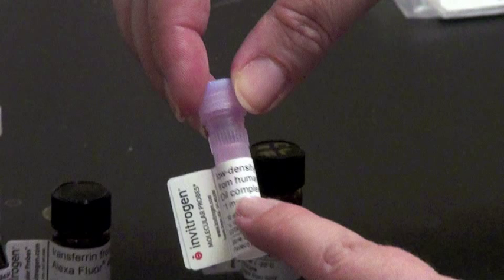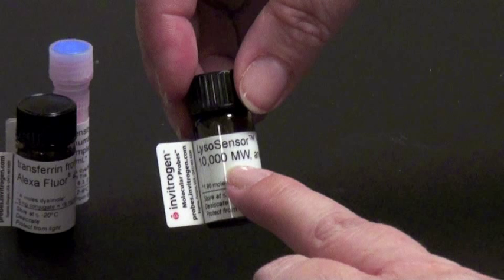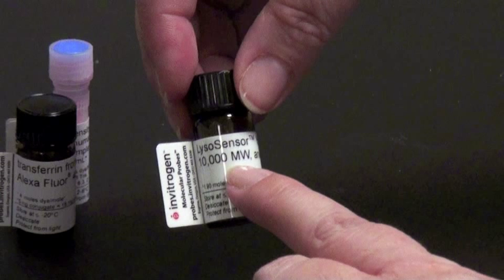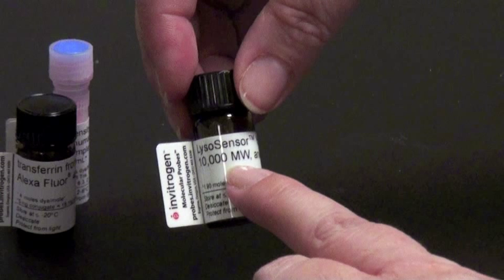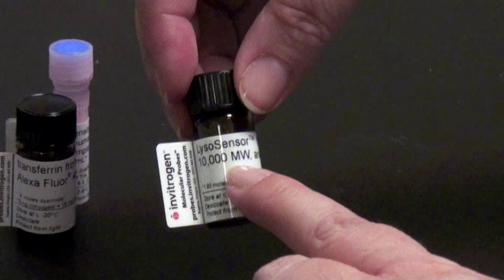Finally, we have LysoSensor. The LysoSensors come in a number of different colors and may have a pH indicator associated with them. So in different vesicles or vacuoles of the cell, they'll change color depending on the pH inside that vesicle or vacuole. These are also a wonderful tool for live cell imaging.